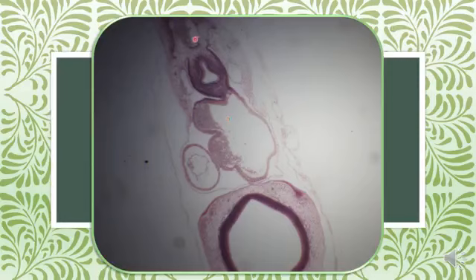Here in these sections also you can see a single dorsal aorta, and ventral to the dorsal aorta, this is the foregut. Foregut beginning to divide by constrictions into ventral, the respiratory diverticulum, and dorsally the esophagus.